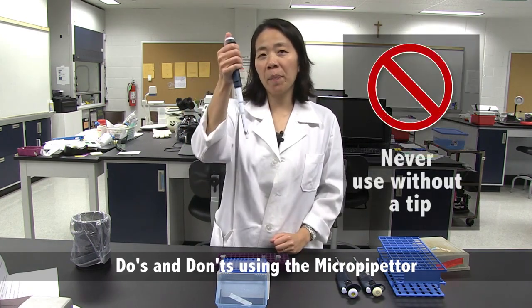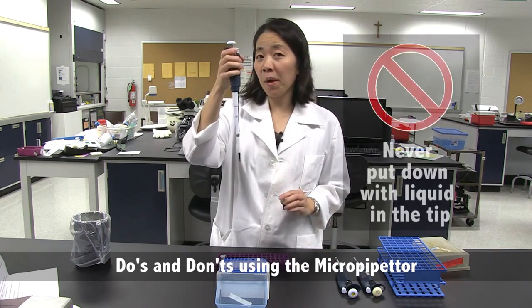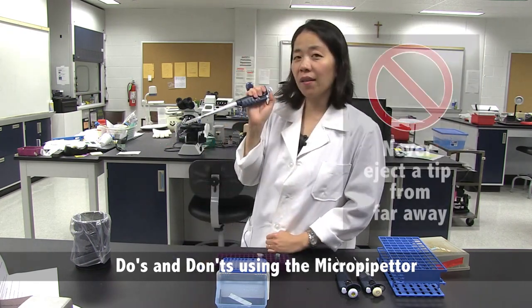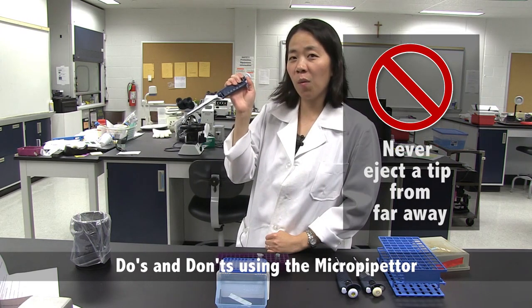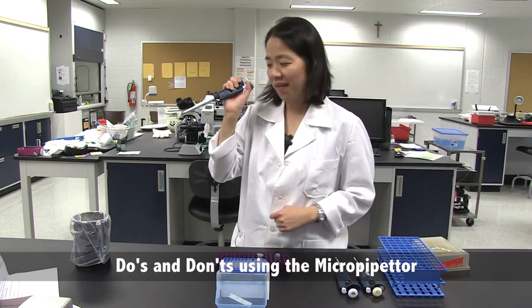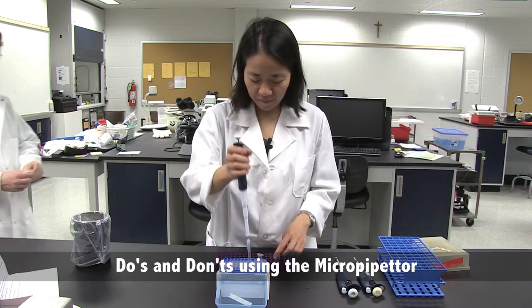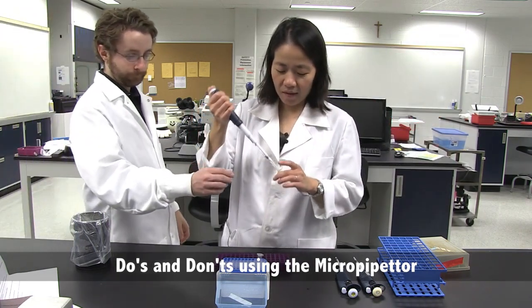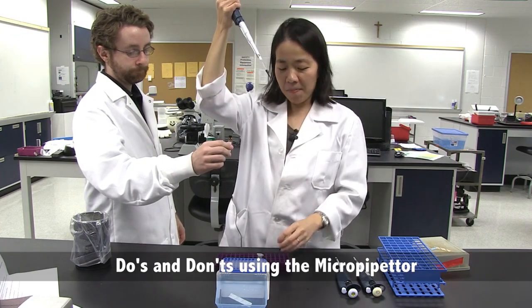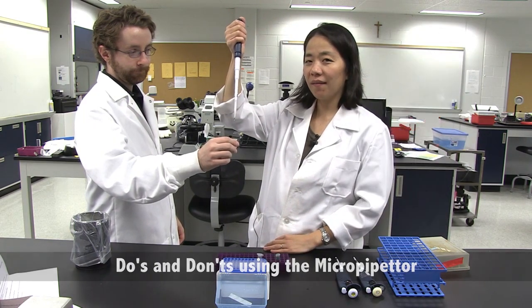Never use a micropipetter without a tip. Never set a micropipetter down with liquid in the tip. Never eject a micropipetter tip far away from the dispensing container. To prevent cross-contamination, never reuse pipette tips. Always bring everything to eye level when you're pipetting, but never pipette into a tube that someone else is holding.